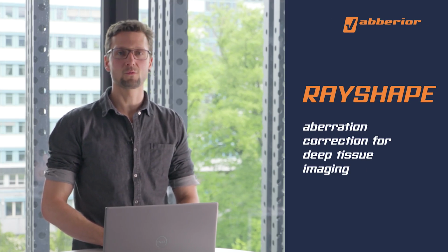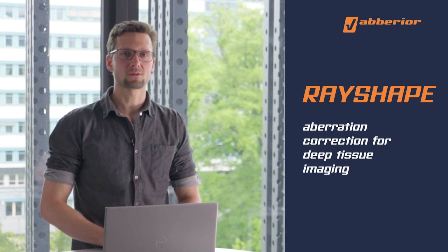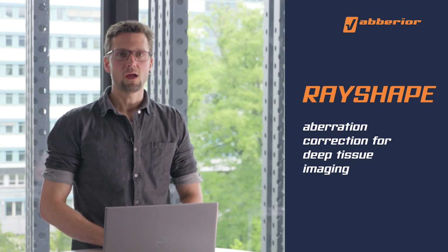My name is Bastian Klußmann-Fricke. I'm an application specialist at Abberior Instruments, and we are here at the Johannes Kepler University in Linz to pre-record this webinar. In the beginning I will talk a little bit about technical details of RAYSHAPE aberration correction and how it is implemented in our high-end microscopes.